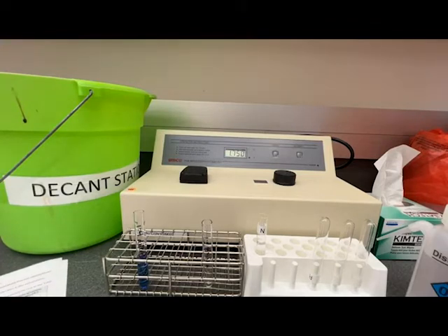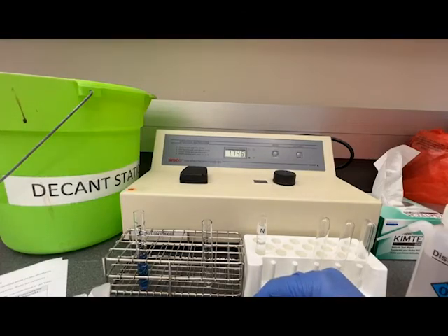This particular model of spectrophotometer does max out absorbance at numbers greater than 1.999. If that happens you will see one dot dash dash dash dash. If that happens please record that as greater than two. If you get a negative absorbance you would record that as zero.